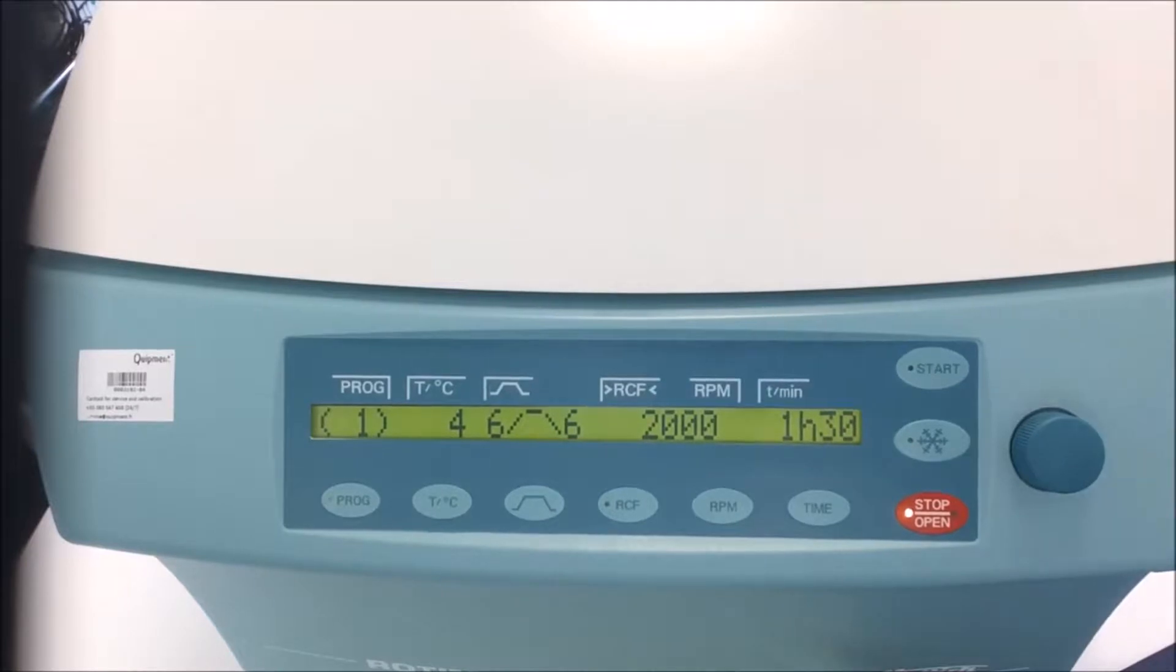And I can start a program centrifugation. On this model, you can configure and load up to 98 programs using the programmation button.